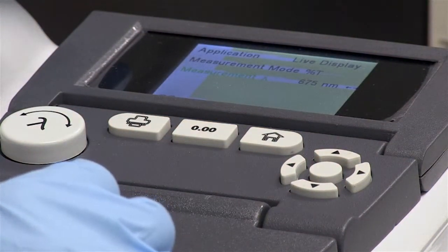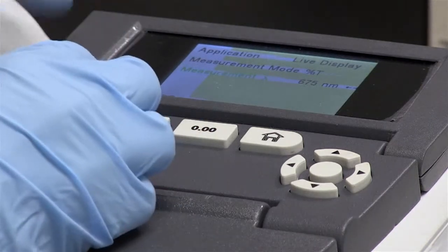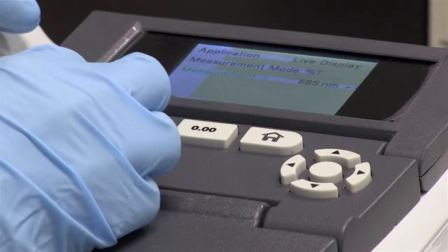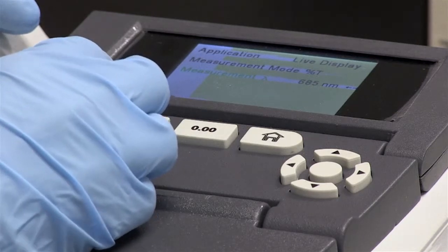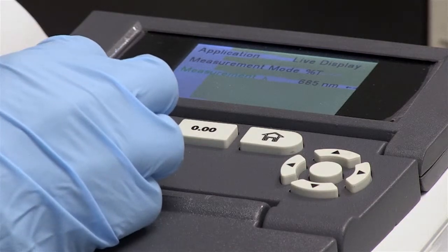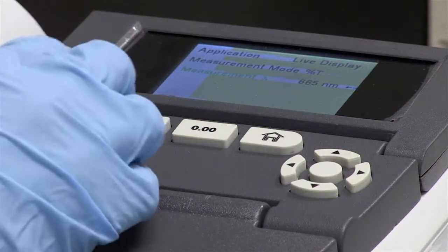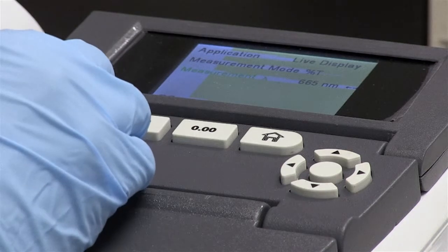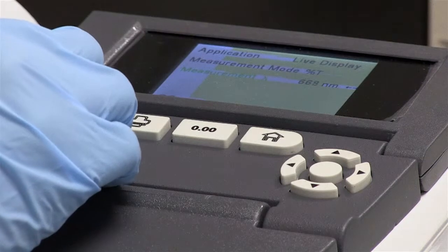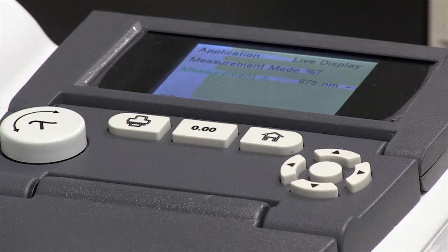If you want to change the wavelength in increments of ten, use the dial marked lambda on the left. Turning it clockwise goes from 675 up to 685; anti-clockwise goes down to 665. You can also use this dial for fine adjustments — press down on the knob while turning, and it will move in increments of one nanometer either up or down. That's how you adjust your wavelength.